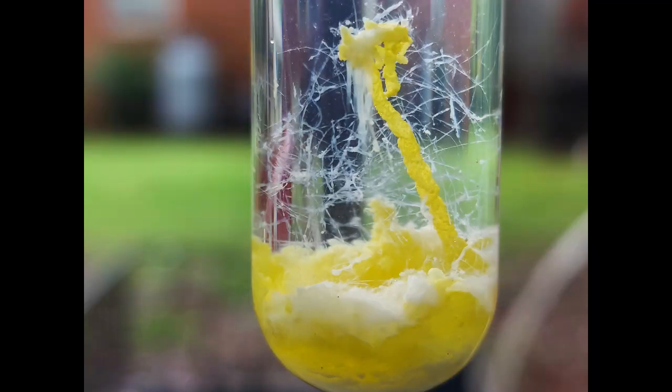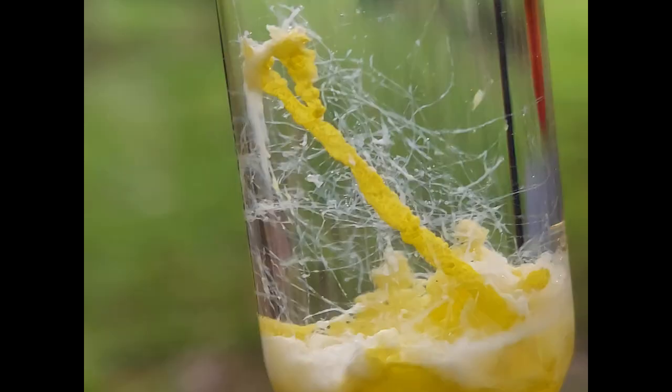I was able to get one tube to grow downward using uranyl chloride, so they will grow down as well as up. Uranyl gardens take a very long time to grow because uranyl chloride solutions are so dense and heavy. The spikes tend not to get very tall. But if you get a piece of the salt that's floating on the surface of the water, the tube will grow downward, and it will do it quickly — as opposed to taking hours to grow upward, it will take like two or three minutes to grow downward. Very interesting thing that I found.